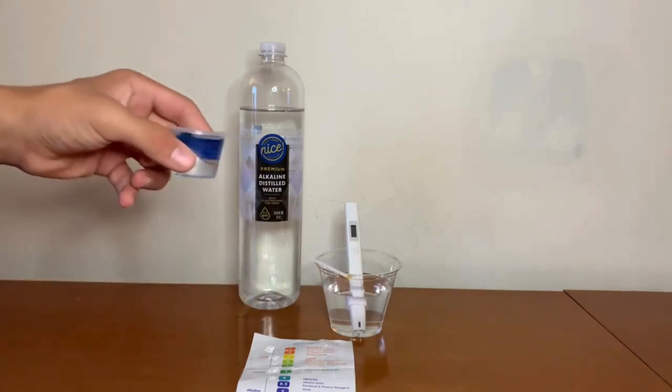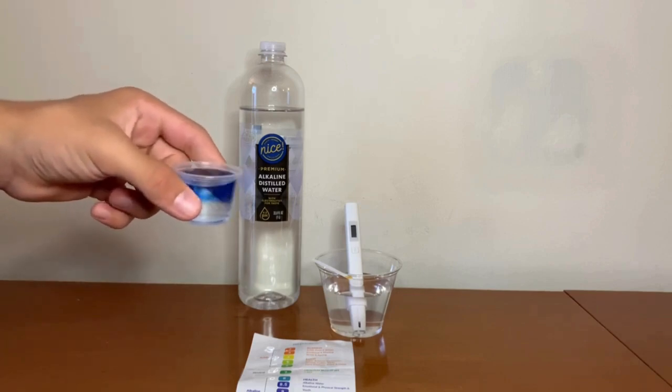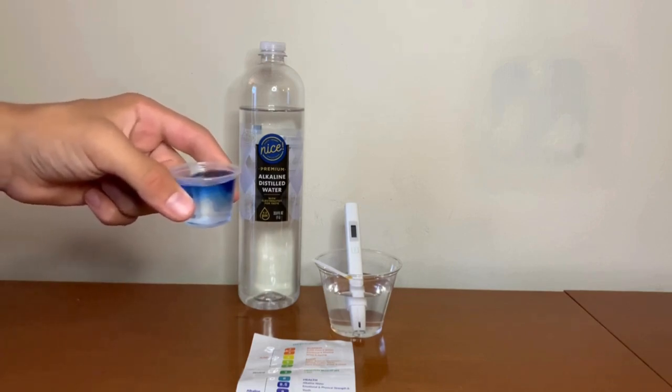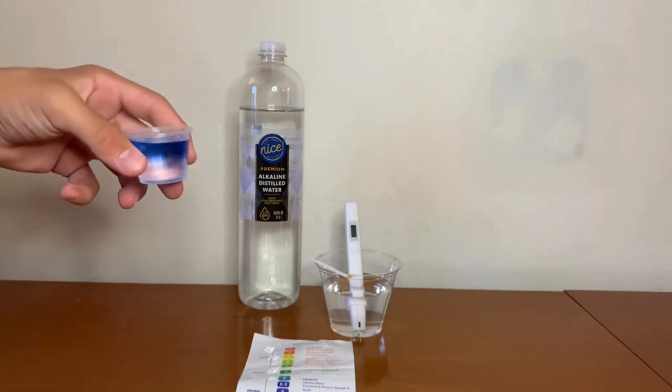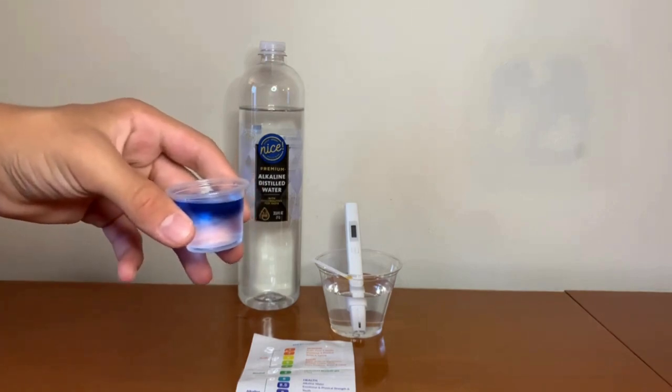Now let's see the results for the pH. It seems to be around an 8 or an 8.5, which is alkaline water.